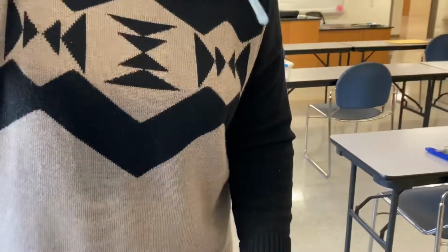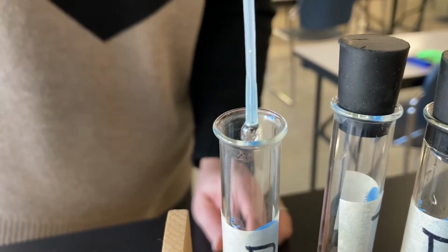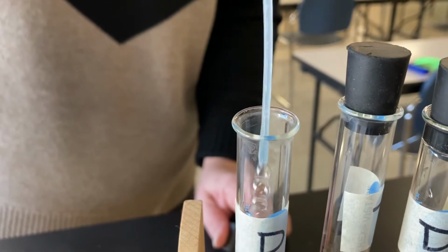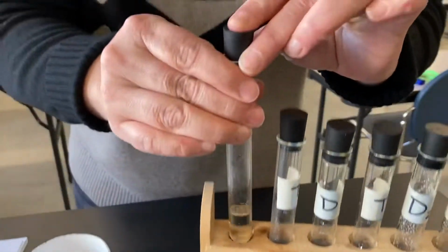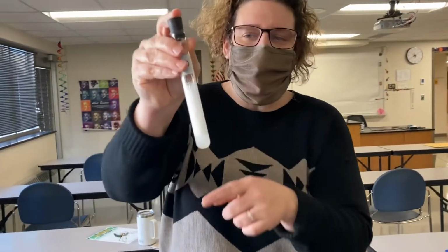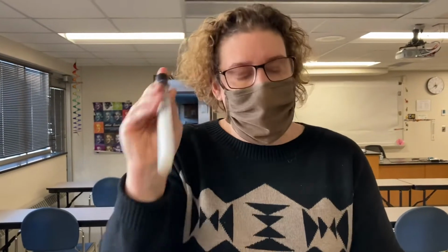And then I'm going to put 1 drop of soap down into our distilled water. Come on, there we go. That's good. Okay, now I'll put the cap on, and then here's what we're going to do: shake it up. You can see already that when you shake it, it creates these soap suds. So we're gonna shake each of these test tubes with 1 drop of soap for the same amount of time. And then we'll come back and measure the height of the soap suds after shaking.